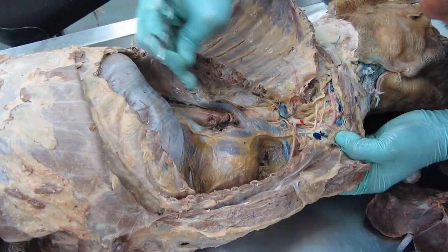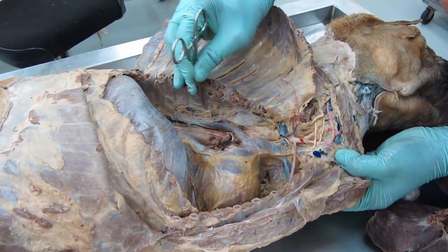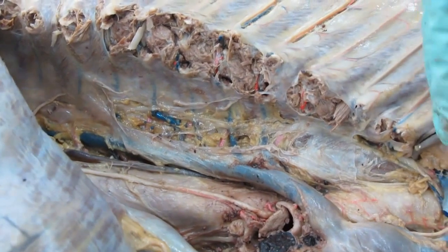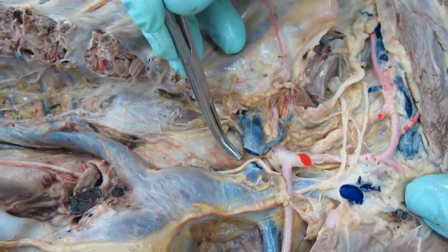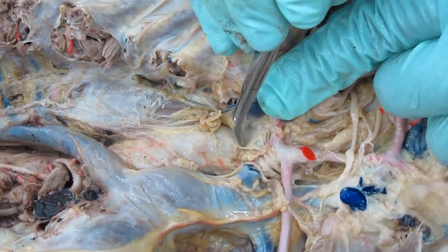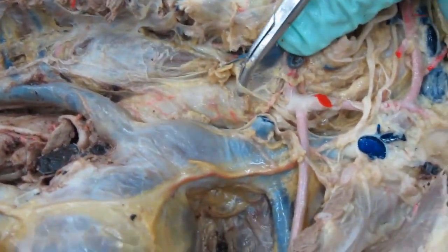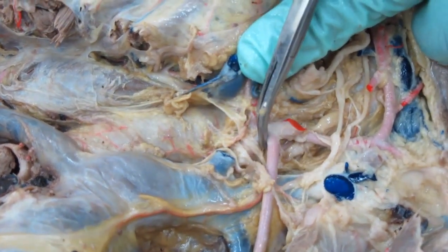As we remove the parietal pleura, we can see the sympathetic trunk. We're not going to spend much time on that. So that is your sympathetic trunk, your stellate ganglia on the right side. We transected this costocervical vein, so we can lift it up and see the underlying structure. So that is your ansa subclavia. Now at this point it is looped around the right subclavian artery.